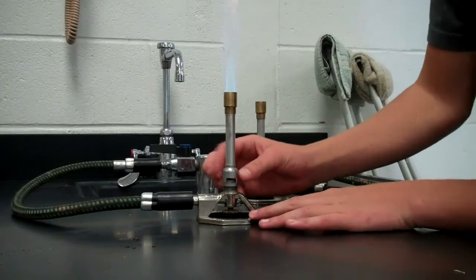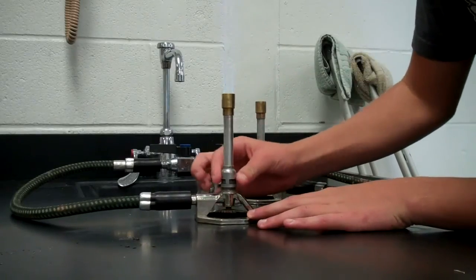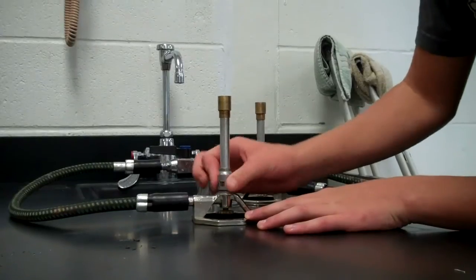If you want it back down to a red flame, turn it down. Twist it at the bottom. Never touch the top.